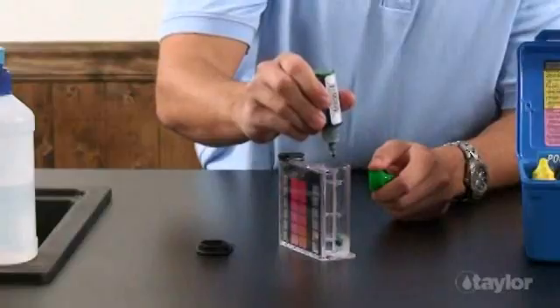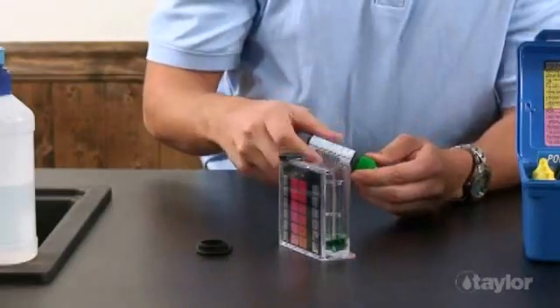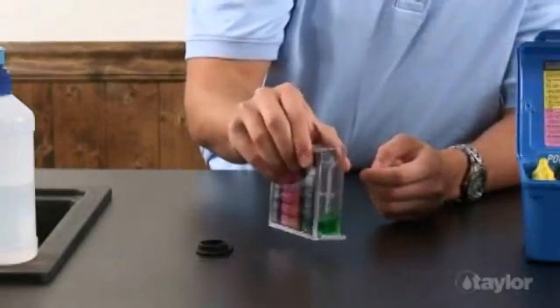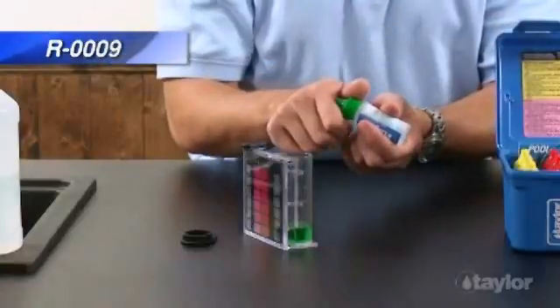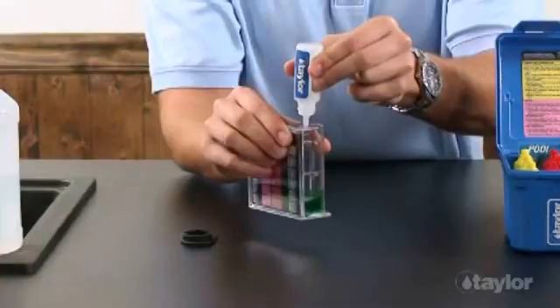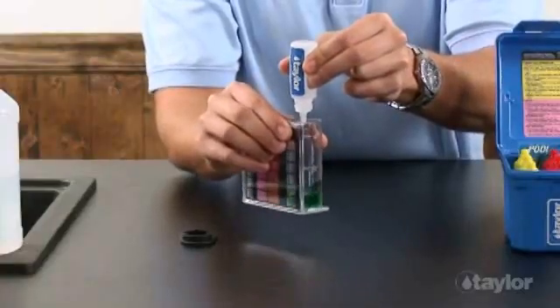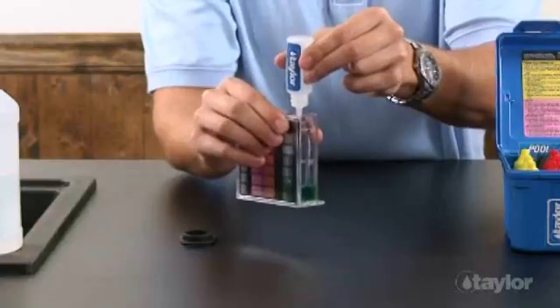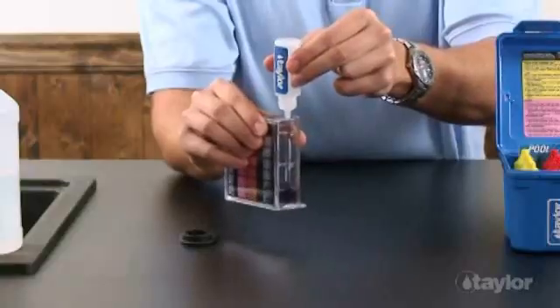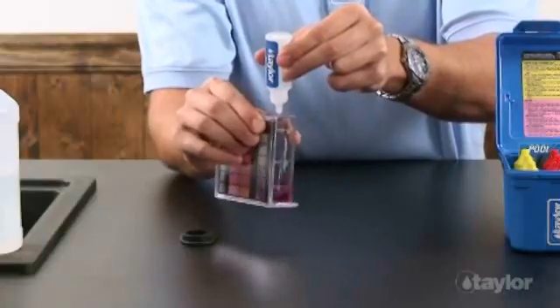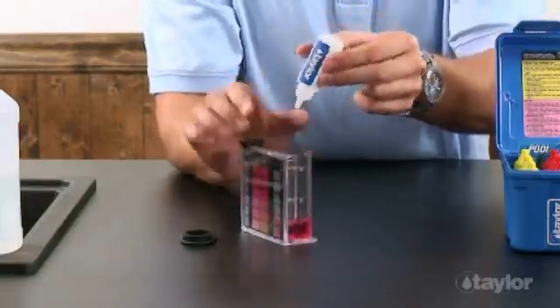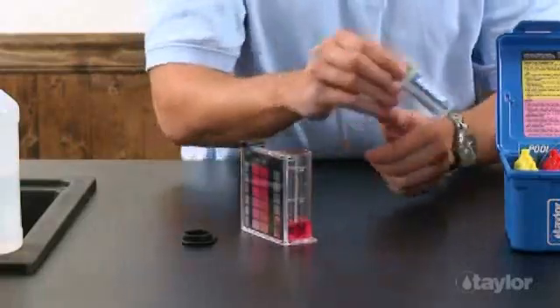and multiply the number of reagent 9 drops used by 25.